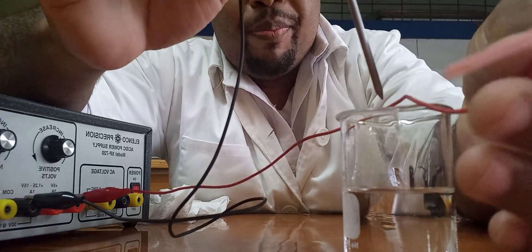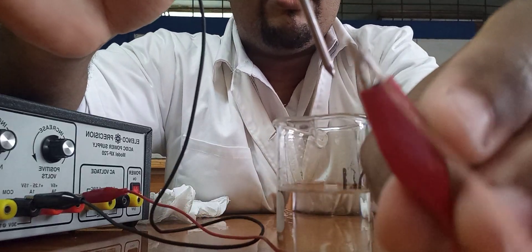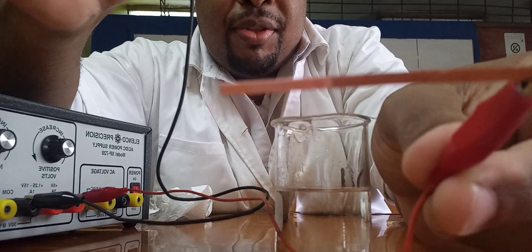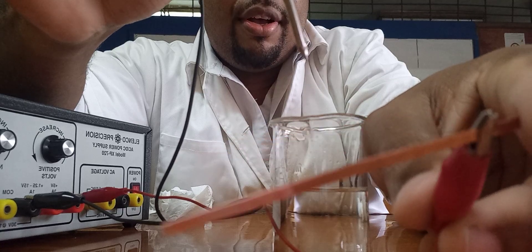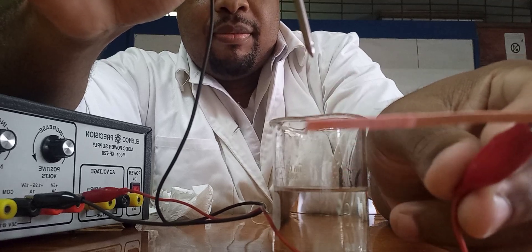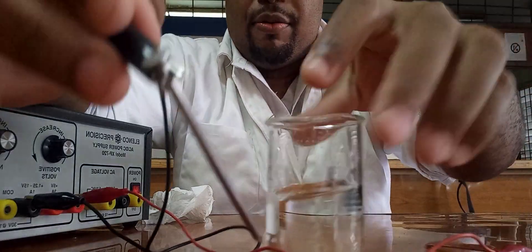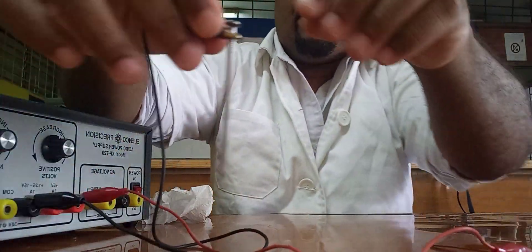If you look at the appearance of the copper metal, notice the top part that is not making any contact compared to the part that is making contact — notice the difference in appearance. So that is hydrochloric acid; we know that it is an electrolyte from observation.